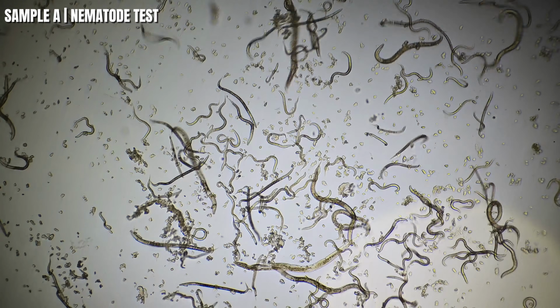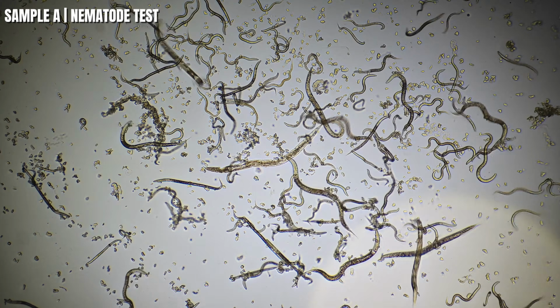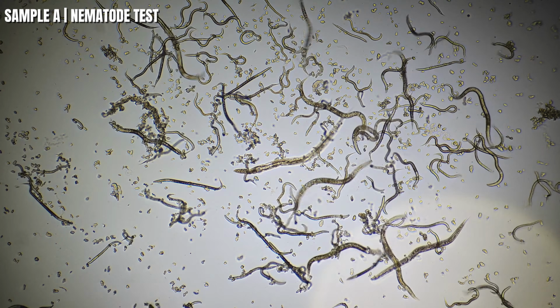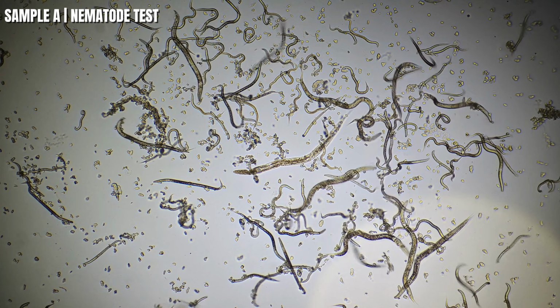Here's the thing, guys. I watched them for about a good half hour, right? And they slowed down a lot. And then, believe it or not, they either woke up or came to because they started to become active again. It's amazing. So I dropped all that on them and they came back to life.